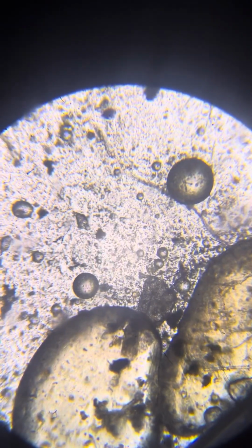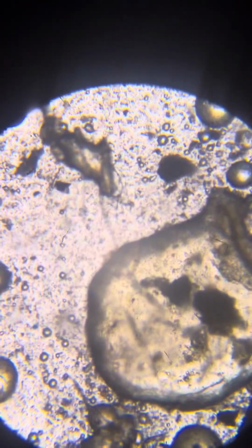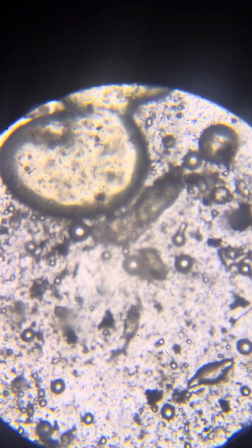From experience, I can tell that when you add sodium bicarbonate to the mixture, it makes them fatter in a statistically significant way. Fat is defined by the proportion of the radius of the circle to how wide the ring is, the width of the ring. And of course, the lower the proportion, the fatter they are.